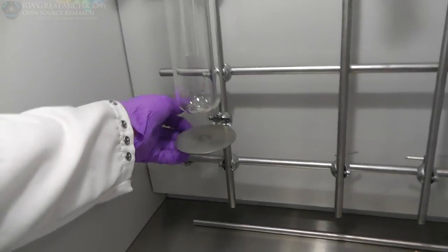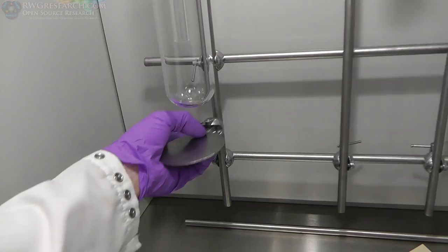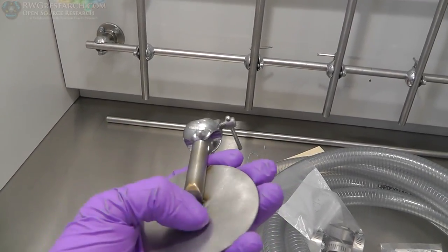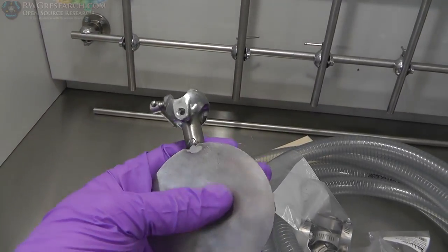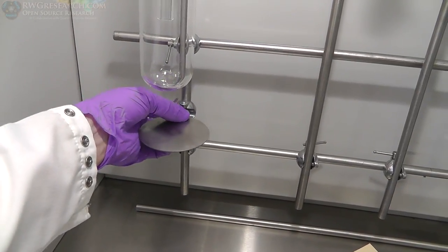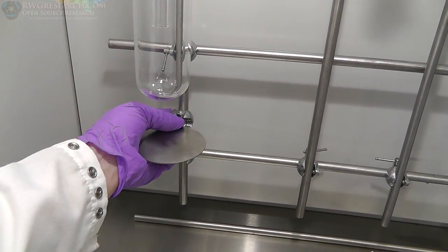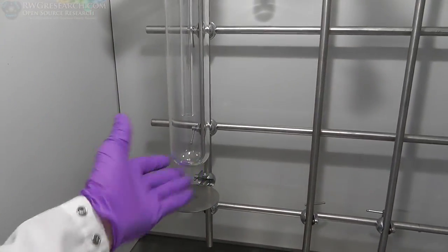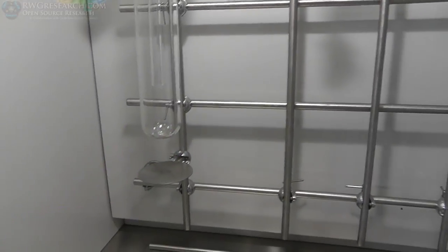And I also built this. This is just a stainless steel plate that I had laying around. Made a rod, tack welded it on there, and put a clamp on it. So I'm gonna make up a few more of these. I wanna make sure this one's gonna work first. So this will be what I use to hold my dewar, okay? So there you go, forgot to say that.